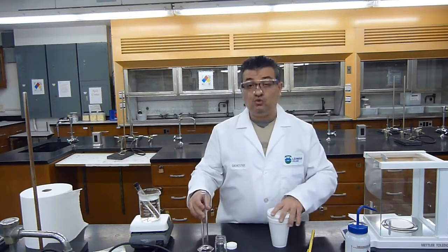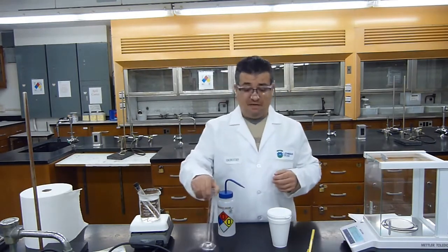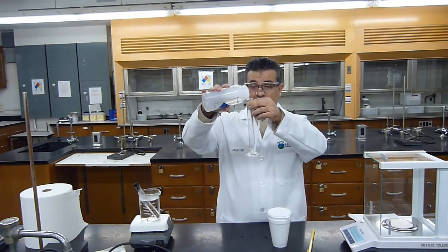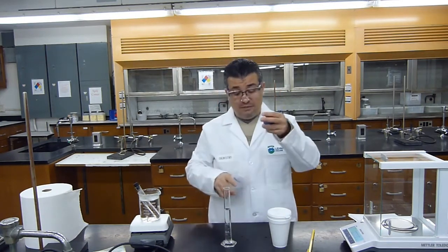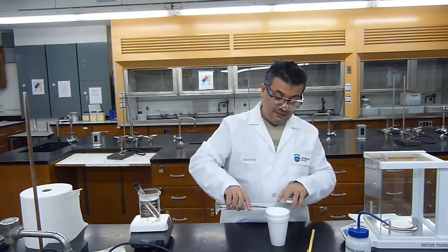Next, I'm going to do 2 trials. The first trial requires 40 mLs of water. The second trial will require 50 mLs of water. Now I will obtain 40 mLs of deionized water, and I'm going to measure it in a graduated cylinder. If the volume goes a little bit above 40, it's okay. If it goes a little bit below 40, that's okay, because what's really important is the mass of water that I have in my calorimeter. That's why I pre-weighed my empty calorimeter, and I know the mass of it empty. Now I will add my approximately 40 mLs of water into my calorimeter.